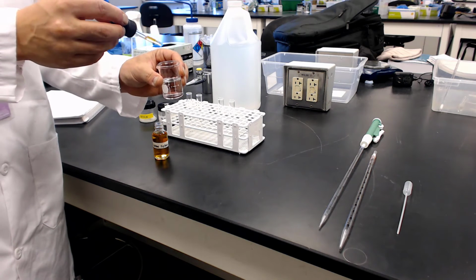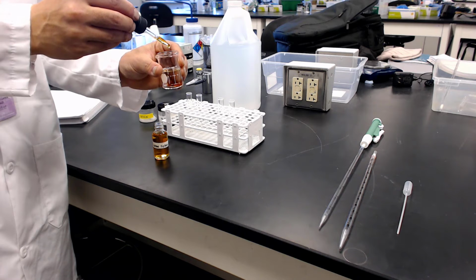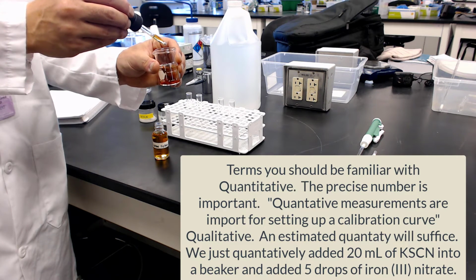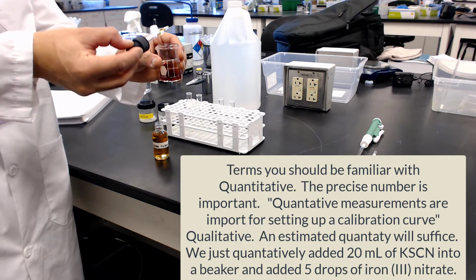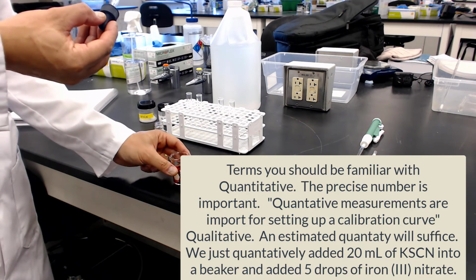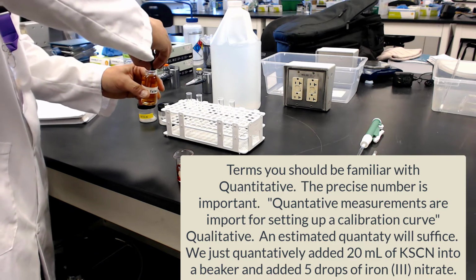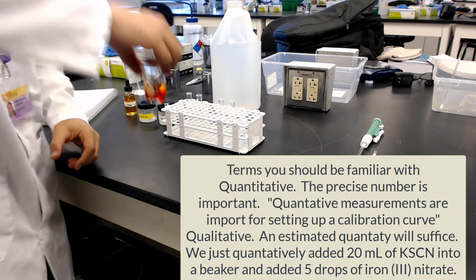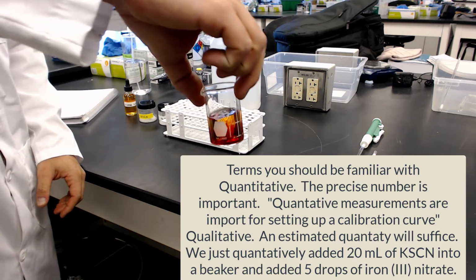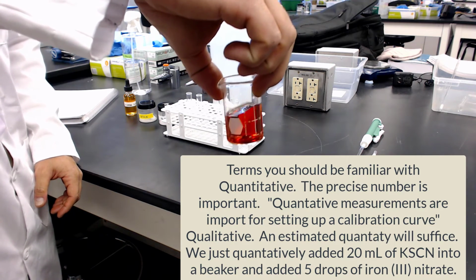So he did that 20 mil by measuring in the beaker, and now he's going to start adding. Remember, what we're doing here is we're not looking to push equilibrium, we're trying to set up the original equilibrium situation. So this is actually creating the iron thiocyanate complex, and you can see it in there. It's kind of red, and that's informative because you kind of know what the iron looks like. If it was just iron by itself, it's kind of that yellow. But this is what the complex looks like. It's kind of a nice red complex.